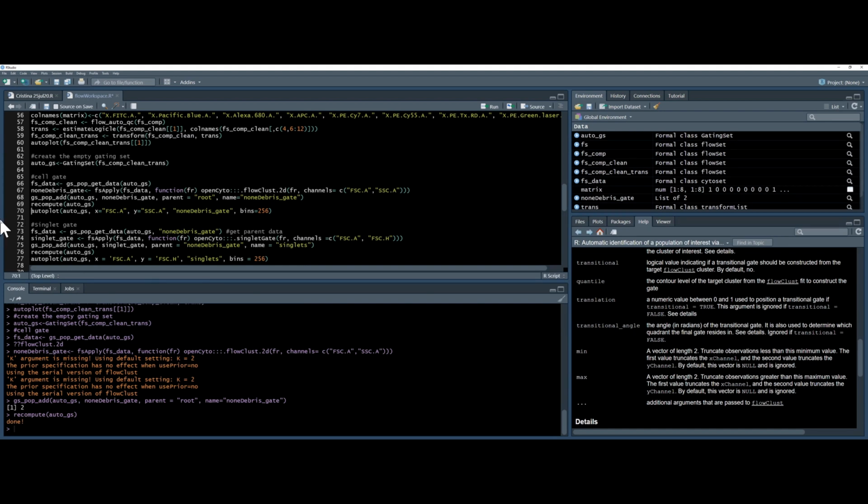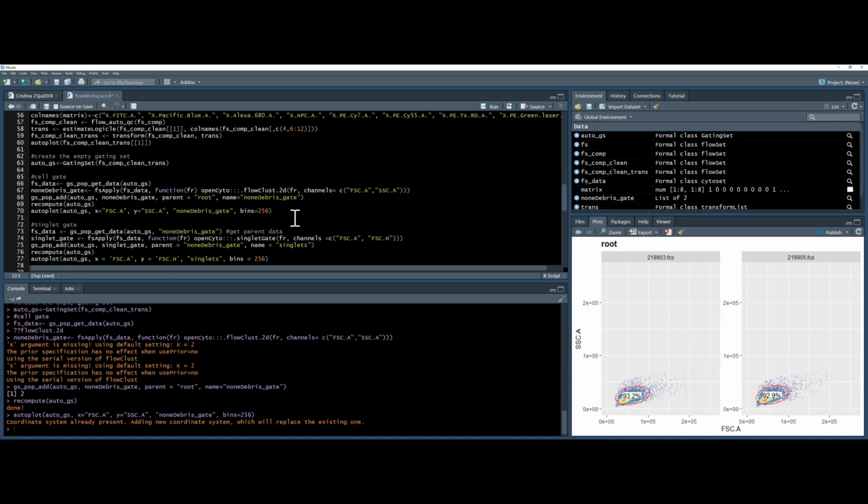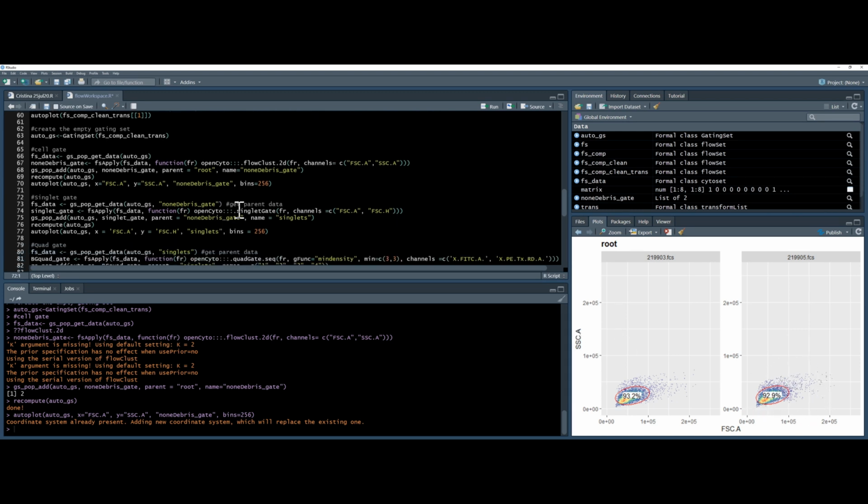And this time, instead of using ggCyto implicitly, I'm using its autoplot feature. So I'm going to autoplot, AutoGS, x and y parameters, non-debris gate, and the number of bins, so that's the density of the dots. And we can see from my 2 files, it's very nicely picked up these 2 populations. I mean, the data is quite clean to start with. Very suspicious oval shape here, but whatever. So anyway, let's keep going.